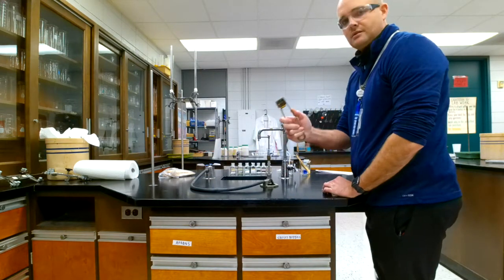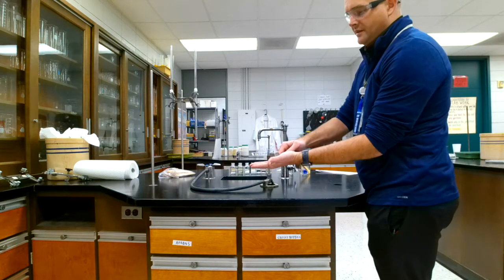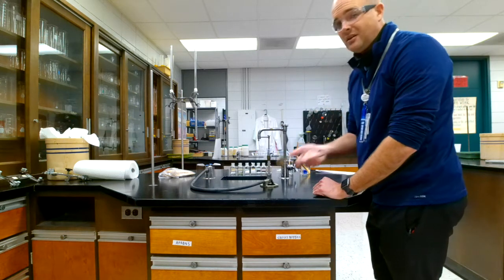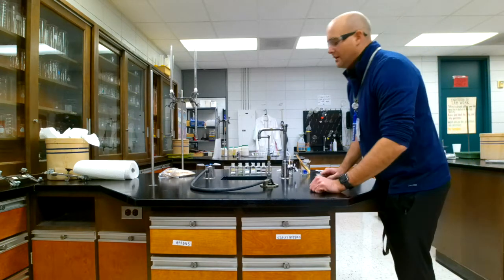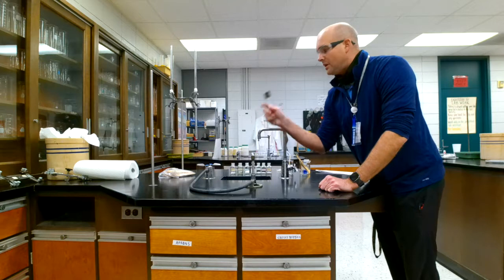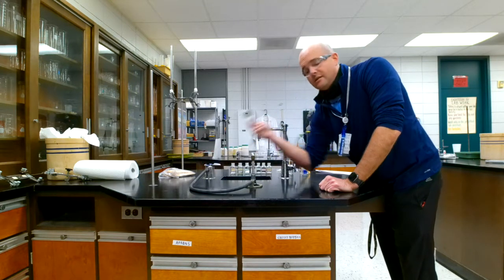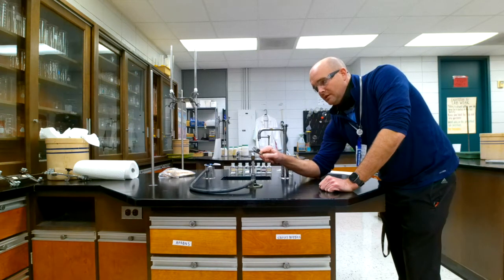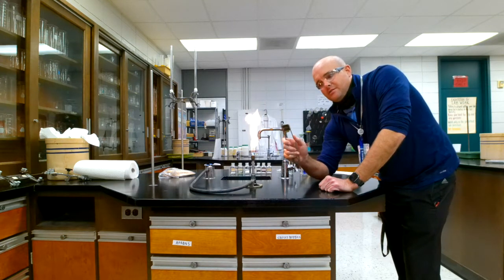Now these strikers look scary, but they don't hurt you, as you can see. So they have a very high temperature. The embers have a very high temperature, but they have a very low energy, so they don't really conduct any heat toward your body. So well, that's what's so cool about them. So to turn on the gas, you need to turn the gas on here, and I can hear it. I can hear the gas coming on. So I'm going to light it just like so. All right. It takes a couple students to figure out how to use one of these. You have to push a lot of pressure towards it.